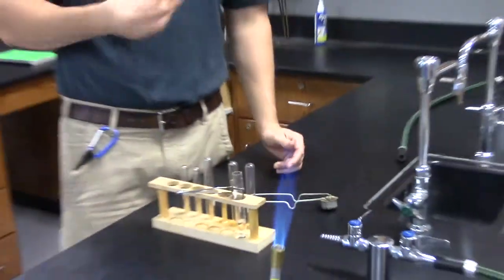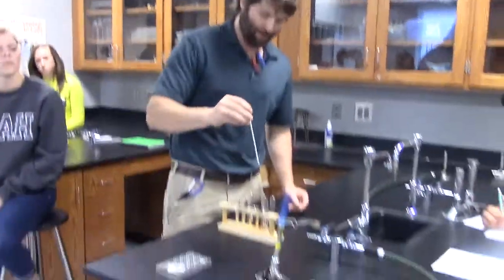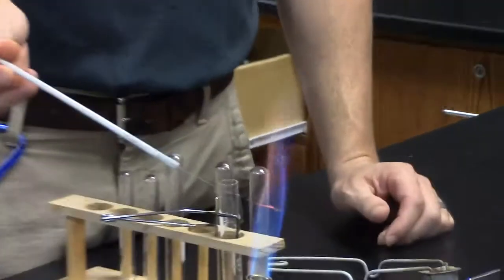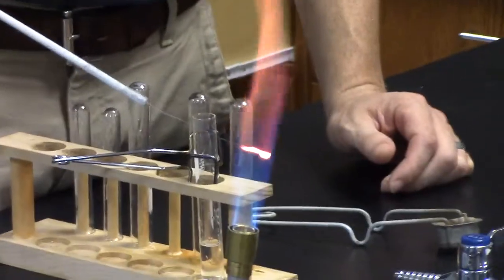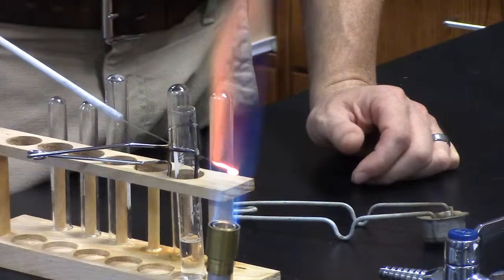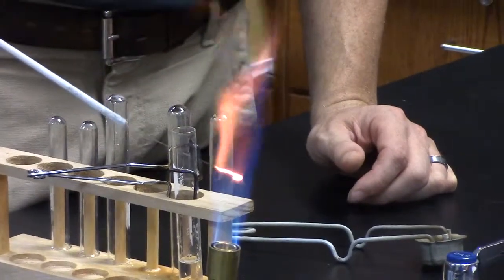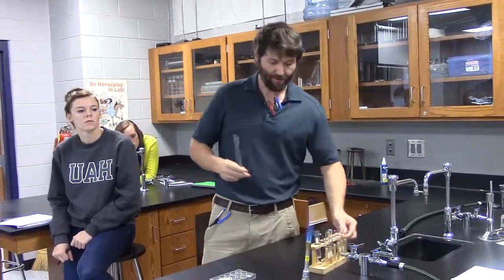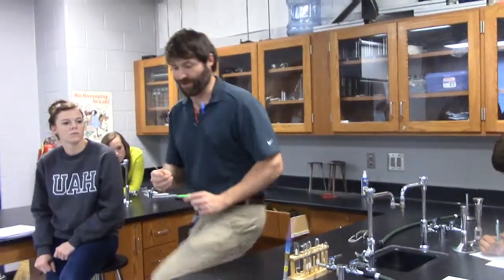If you're in doubt, cool it off a little and stick it in. You can do it again. Rinse and repeat. But this is how you clean the loop. You dip it in the acid. You notice which part of the flame I'm putting it in? The blue. I'm putting it in that blue tip down in here. Now I've got this loop clean as all get out, or at least as clean as I'm going to get it. So how many times do you have to do it? Like once? Hopefully just once. If you have to do it twice, you can do it twice. In reality, once should do it.